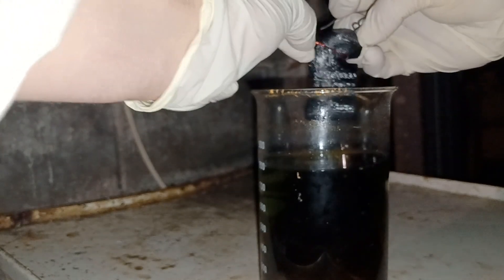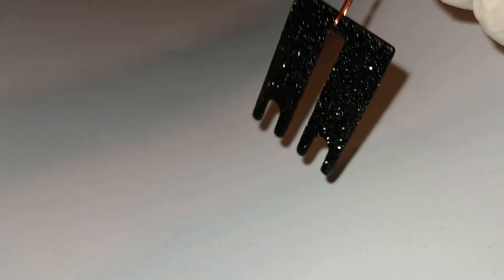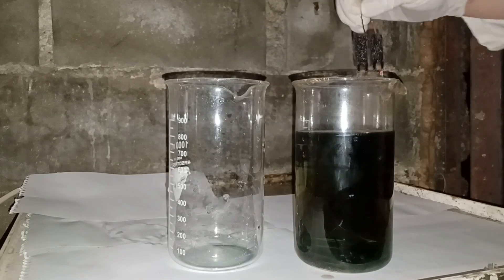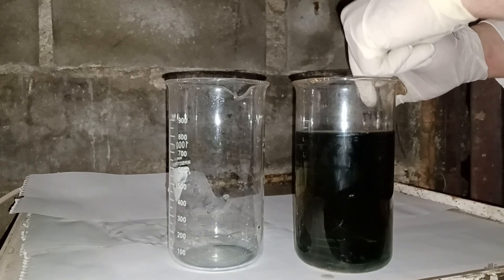At first what I was removing was an amorphous looking black layer, but after a few days visible crystals began to form. When I decided to collect the cemented palladium I scraped and washed the copper and carefully decanted the solution.